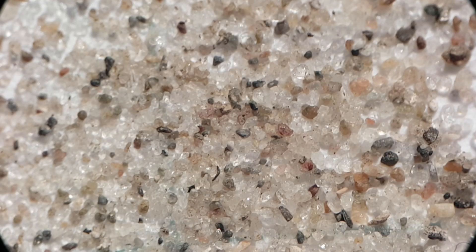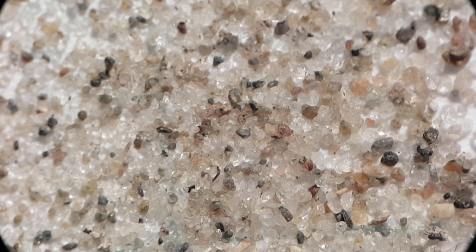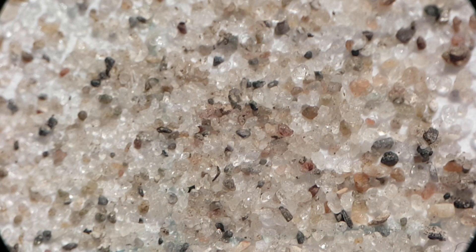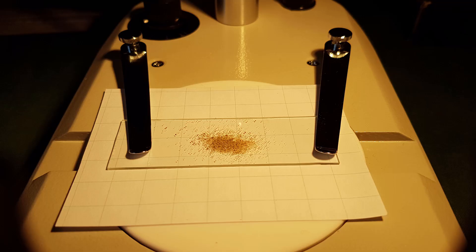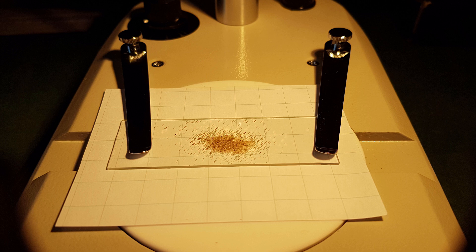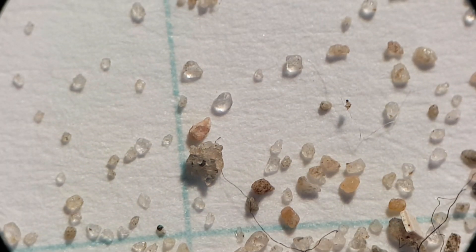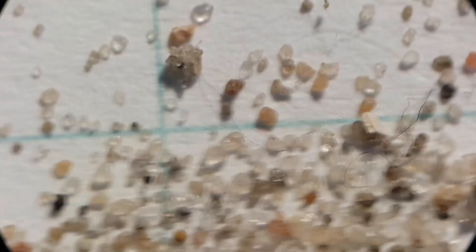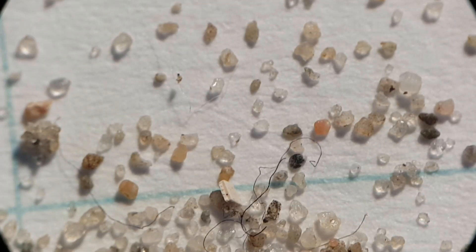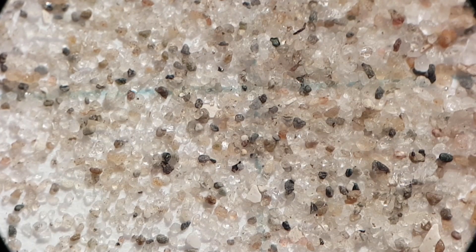Hello everyone and welcome back to a new episode of looking at random common and not-so-common objects through the microscope. Let's start off today's episode with some sand. Also fun to mention: I got a request to use millimeter paper, which is a great idea. I don't have any yet, so what you're seeing here is centimeter paper — but baby steps. Anyway, let's go to a higher magnification.